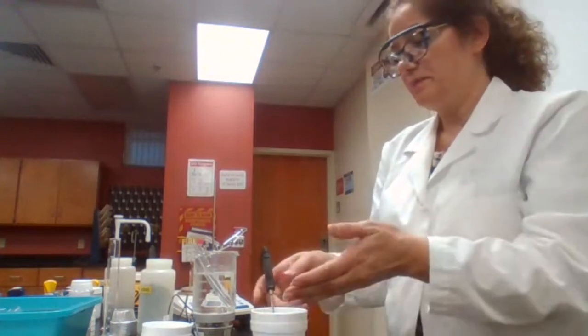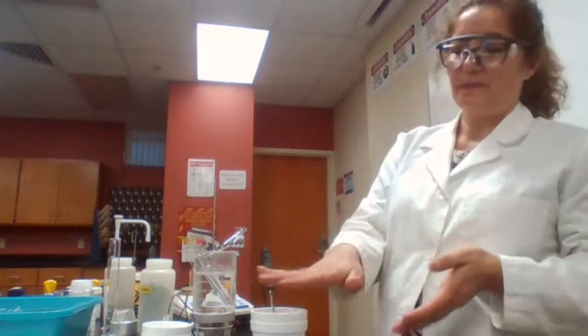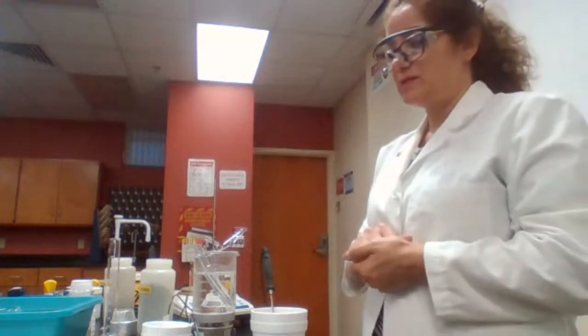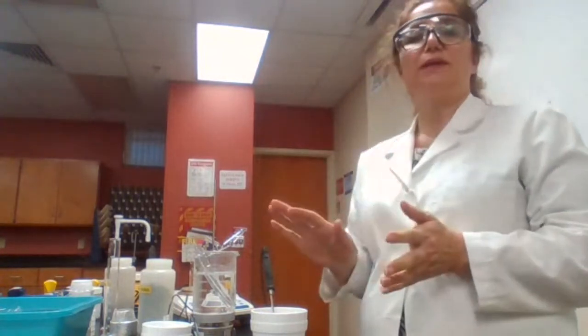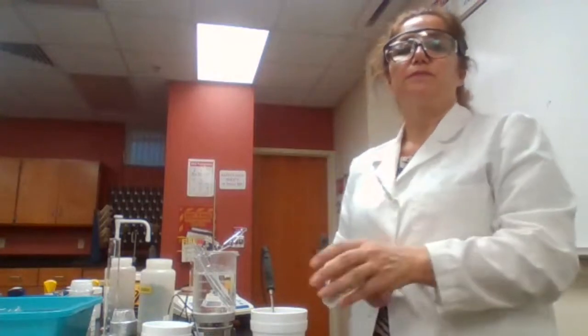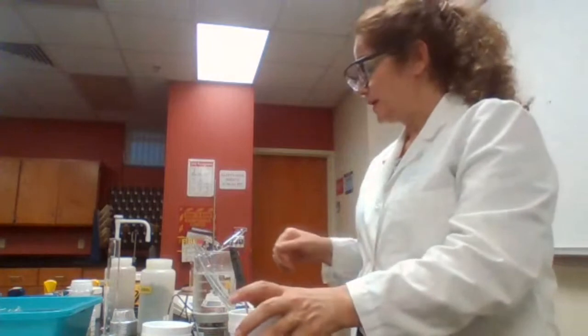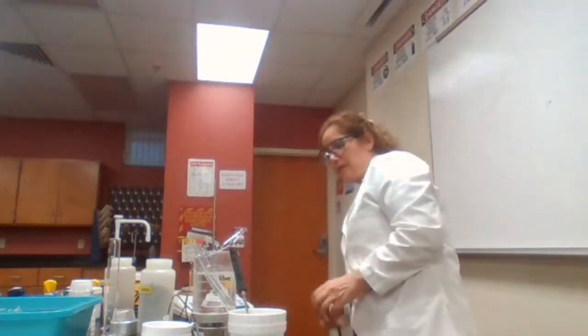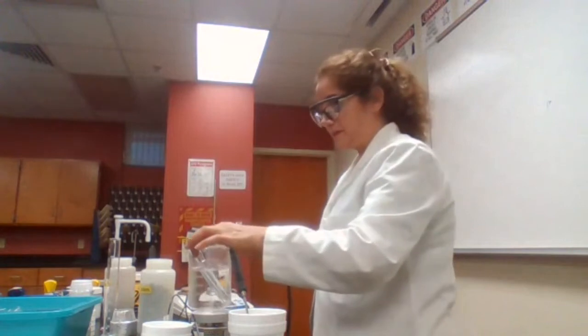If I wait longer, of course, because it's open, the temperature is going to go down. So there's really no need. When I see that highest number, 28.0, I can record that number. And is that for F? Yes. Okay. That's for part A of the experiment.